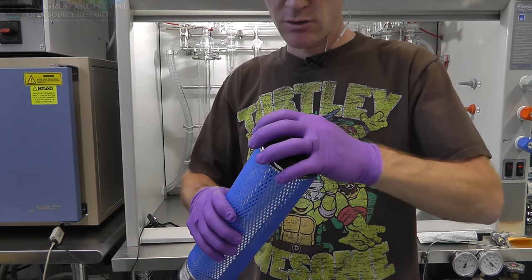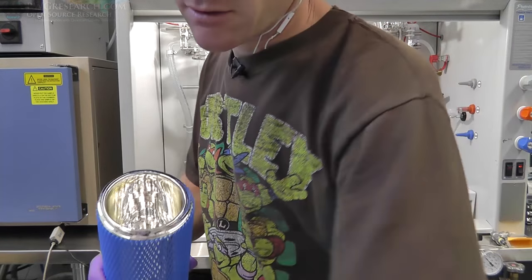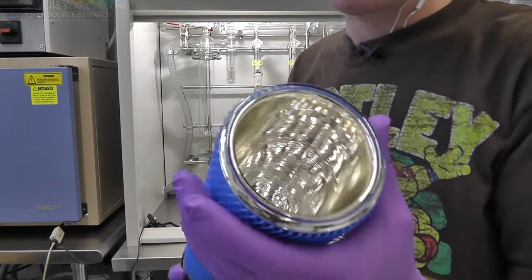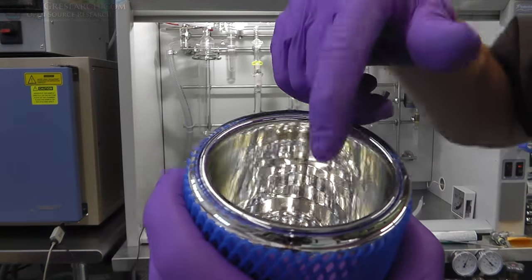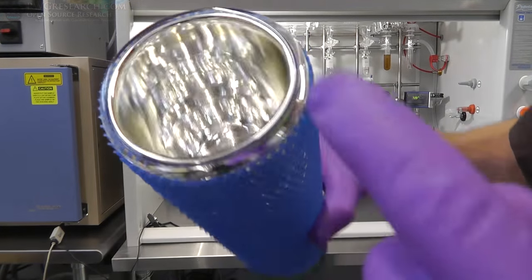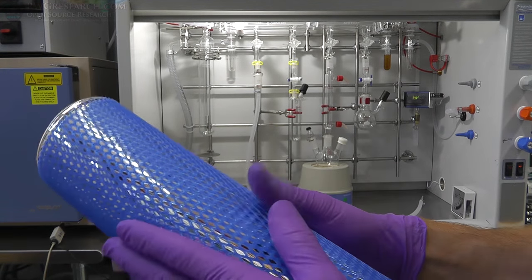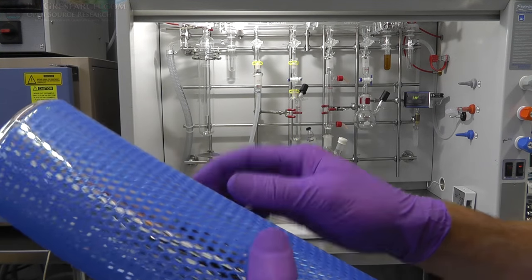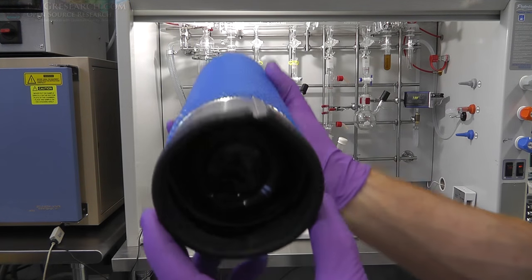This is actually a liquid nitrogen dewar. So this is a glass dewar. As you can see, it's got a silver finish on the inside of the glass, not on the inside of here. It's got a protection sleeve on it. This is so you can handle it, or if you accidentally bump it with something, it won't just shatter the glass. And it's actually got a stainless steel base on it.